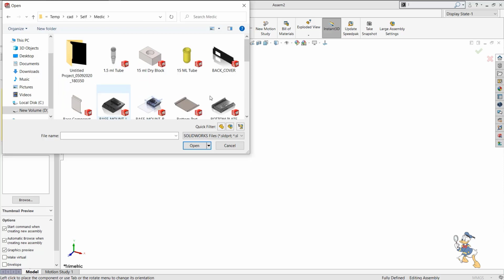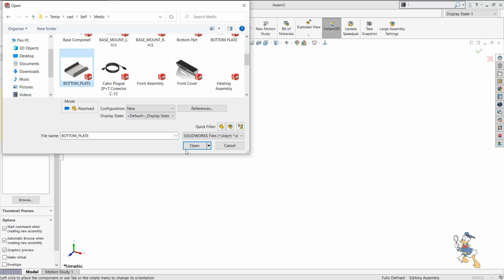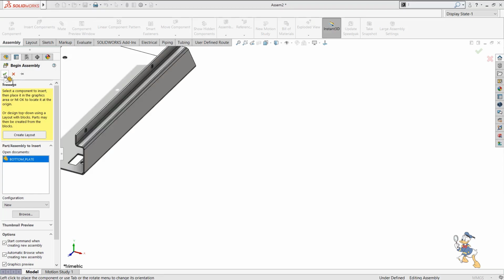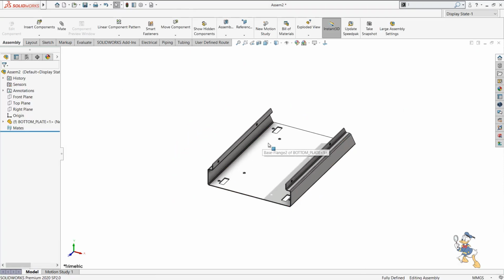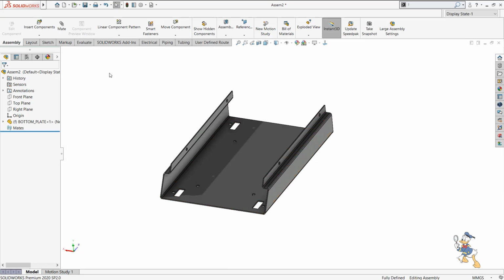So this would be like a bottom plate. Where is the bottom plate for us? This one is the bottom plate. I just need to open it, and I'll place this plate at a specific value, which is a predefined value for this component in the assembly. So it automatically fixes it over there, or we can place it over here as well. I will just check it out and place it, adjusted at some specific standard space in the assembly.